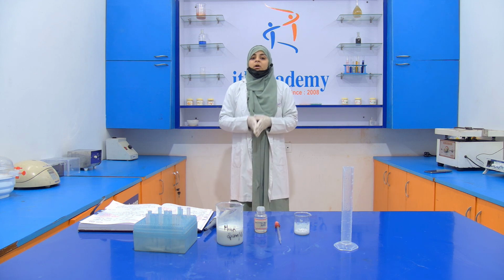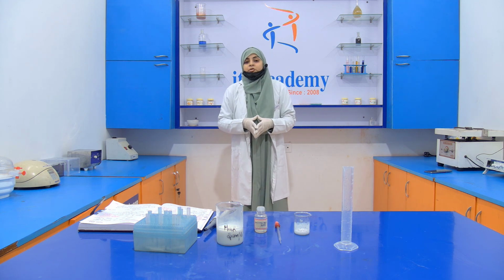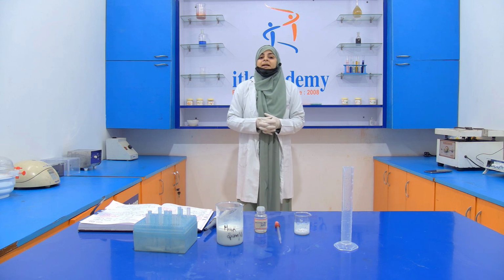So this is all about the determination of skim milk powder in natural milk. I hope you will understand.